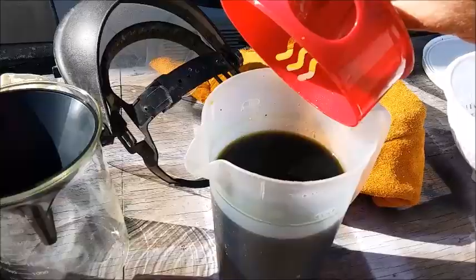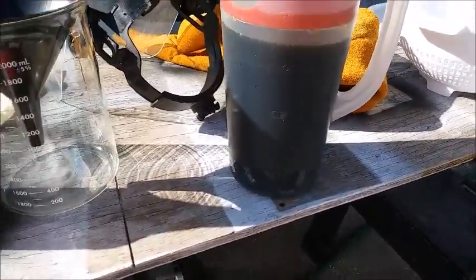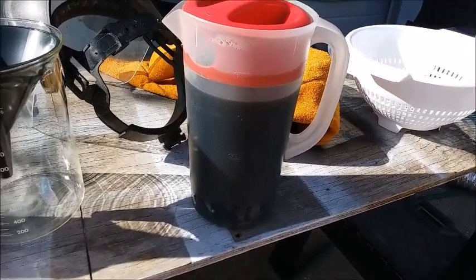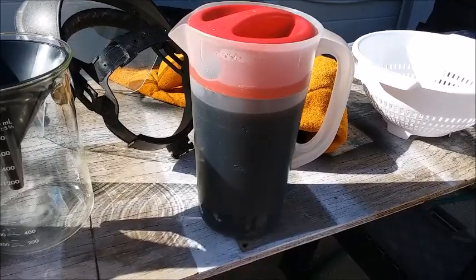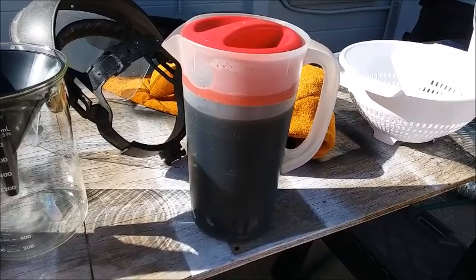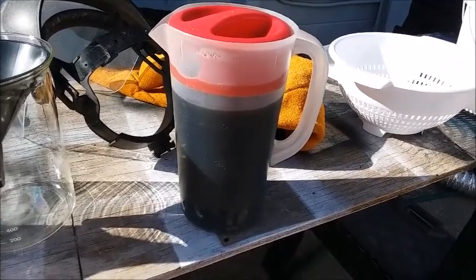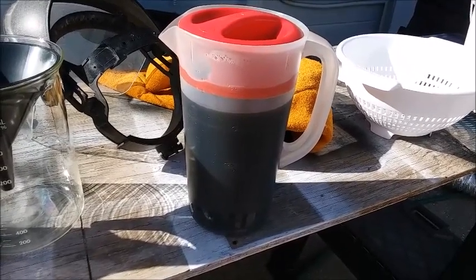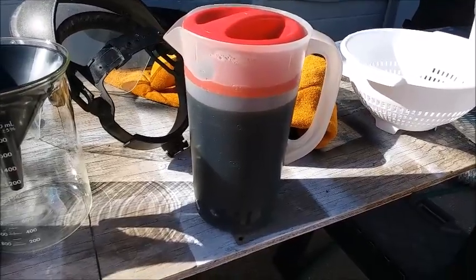The liquid has gotten really dark and pretty opaque, but if I swirl it around I can see a lot of gold that's come loose. I can also see there's still a lot of gold that hasn't come loose yet, even after more than a week. I've done a little more research and found that a lot of people use an aquarium bubbler, which keeps the liquid agitated and adds oxygen. Oxygen is apparently required for dissolving the base metals, and the bubbler helps once the hydrogen peroxide gets depleted after a couple of days.